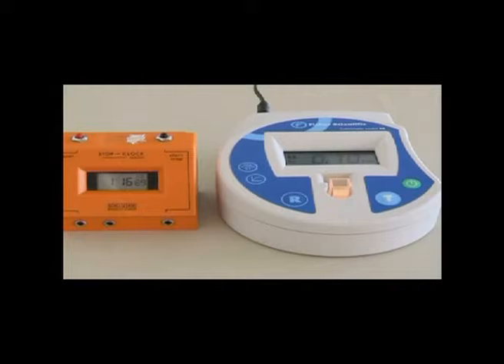This graph will have a straight line portion due to the fact that the substrate is in excess. That is the milk powder, or the protein in the milk powder. However, once the amount of protein in the milk powder reaches a lower value, the rate of the reaction will start to level off and the graph will become non-linear. For the experiment, you need to know what is referred to as the initial rate, and this is given by measuring the gradient of the straight line part of the graph.